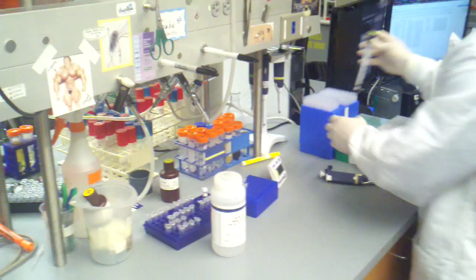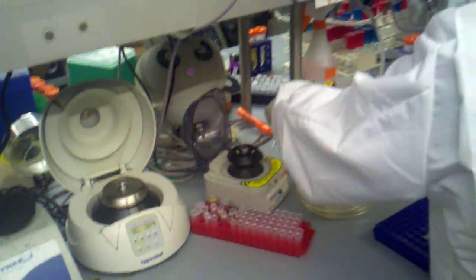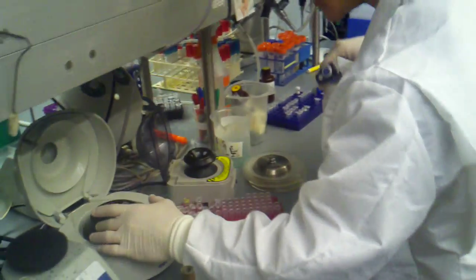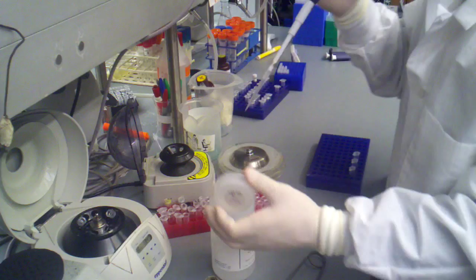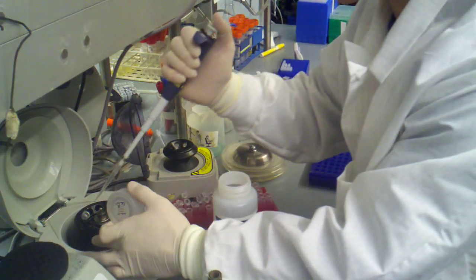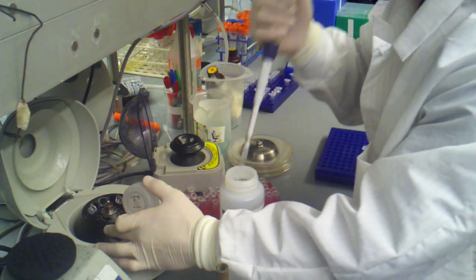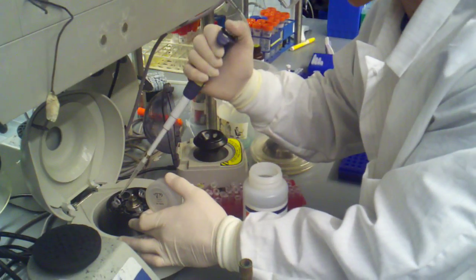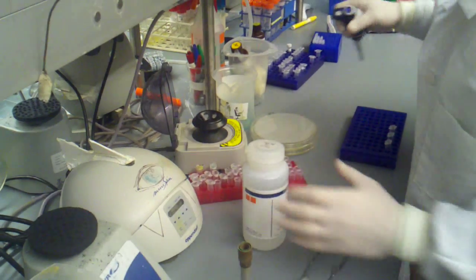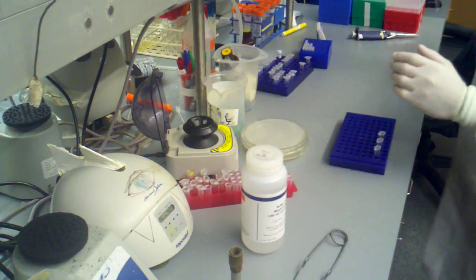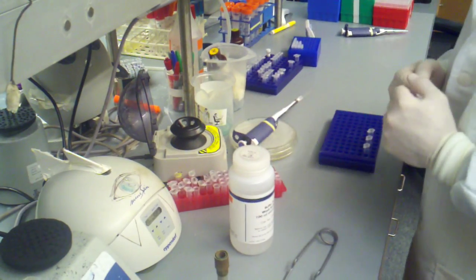So I'm going to pay back. My P1000 is set to 250. And I can kind of take a look inside of these tubes. They all look dry, and the flow-through is empty, so I don't have to double-check it. So I'm just going to pick up 250, and one, two, three, and I can reuse that same tip because I haven't really touched anything and contaminated it. So I'm going to let this spin for 30 seconds.